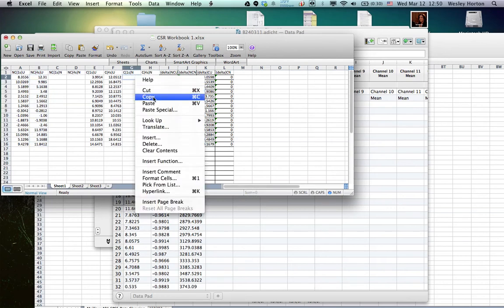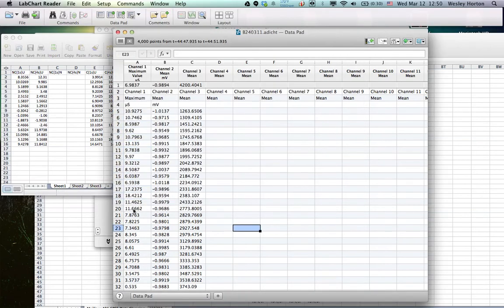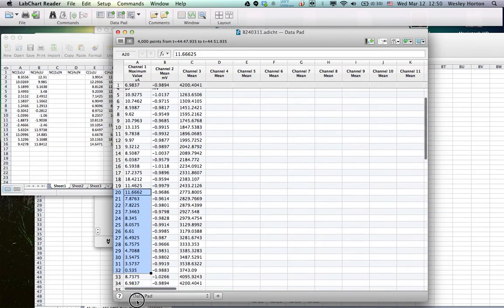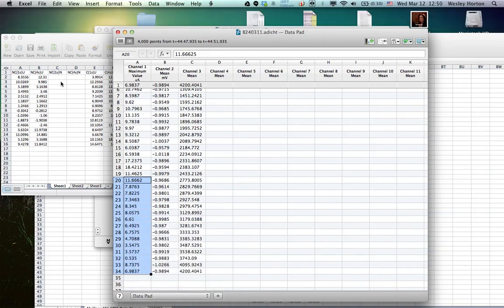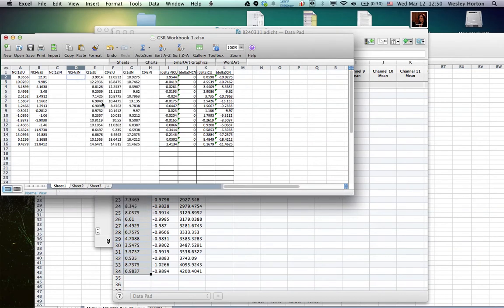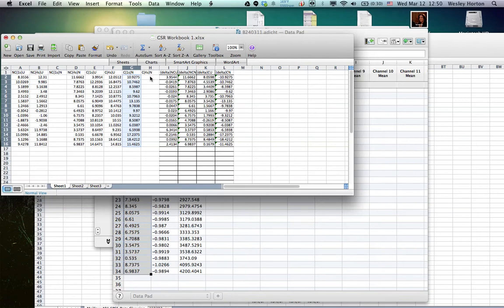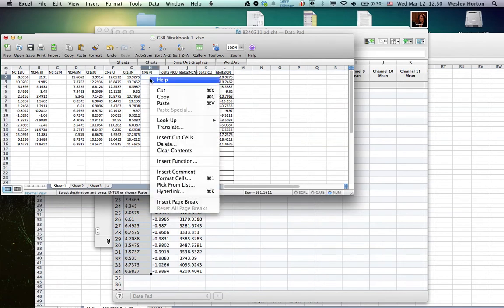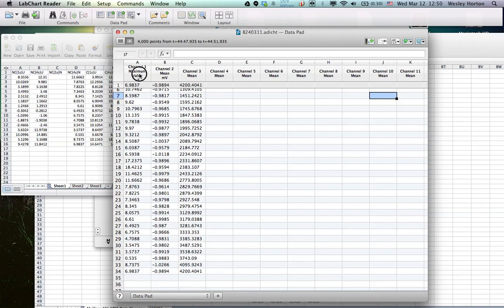It's the first 15, so it's going to be under SIBS. And last 15. It's going to be non-SIBS. Paste. I actually put this in the wrong place. So move that. Cut. Paste. Alright. And then we're going to do one more.